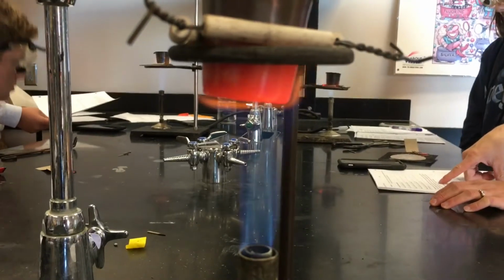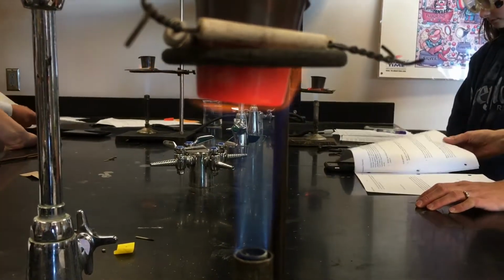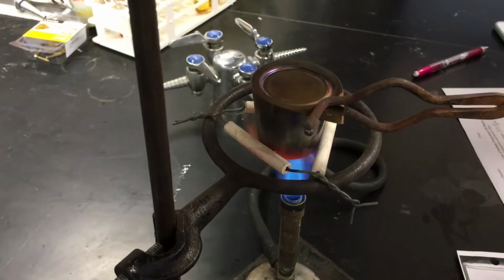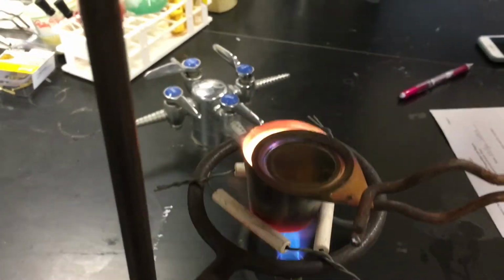What are we describing, the reaction? It's hard. Hey, Gabe, I don't think that was right. Oh, that's right. Oh snap, that's okay. Ow! Turn the timer.